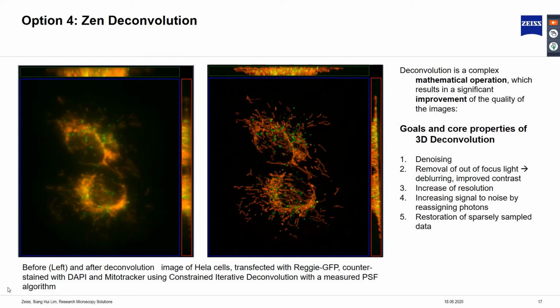The examples shown here are images of transfected HeLa cells with Reggie protein and counterstained with DAPI and MitoTracker. On the left is the widefield image, and on the right is the same image after deconvolution using the constrained iterative algorithm. When comparing both images, we can see that deconvolution has the property to denoise, improve contrast by removing out of focus light, and increase the resolution.